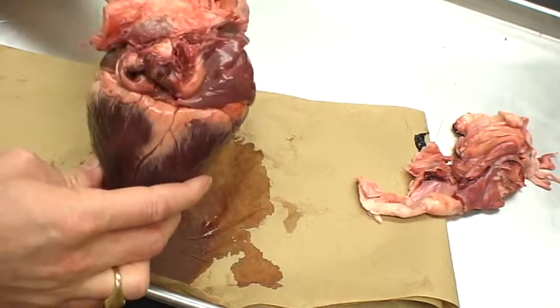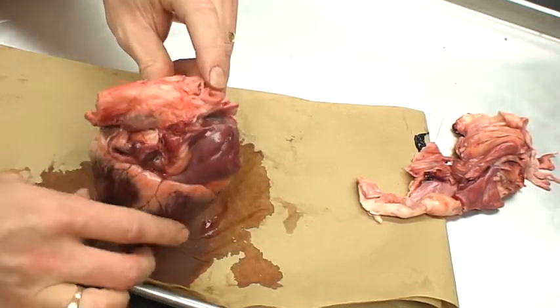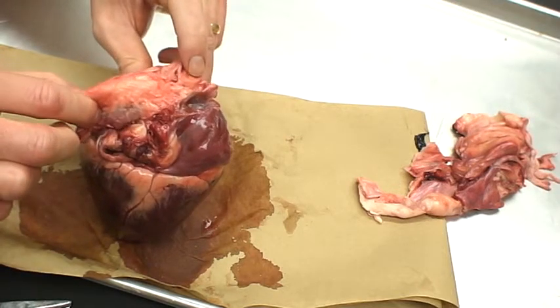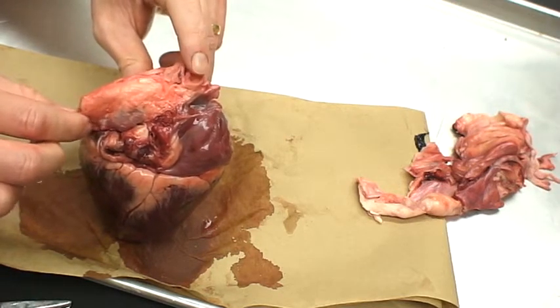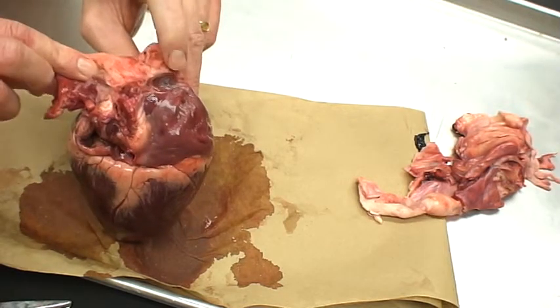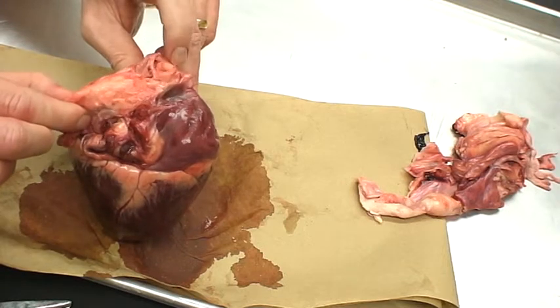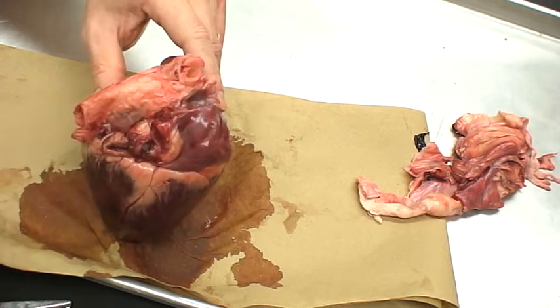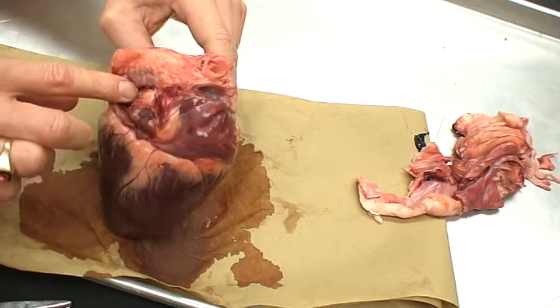We also have structures like the brachiocephalic artery. We see the aorta here and the brachiocephalic here. Now, if you remember with the cat heart, we had one brachiocephalic and a left subclavian coming off of that. The deer heart is set up a little bit differently, where we've got the aorta, we're going to have brachiocephalics, and then they will branch to the subclavians. So we'll address some of those differences at a later time.